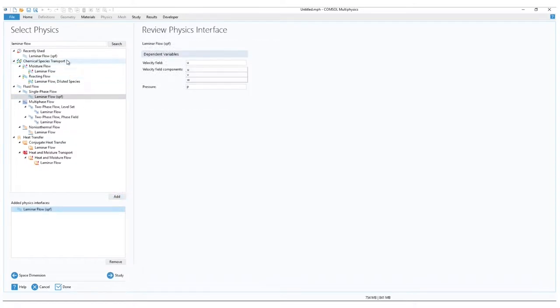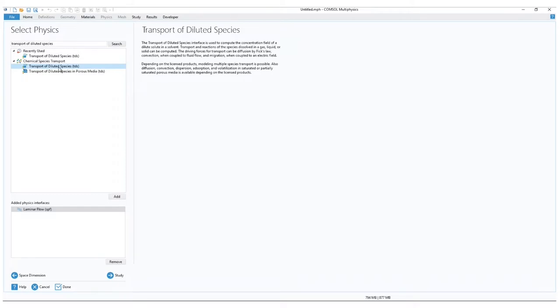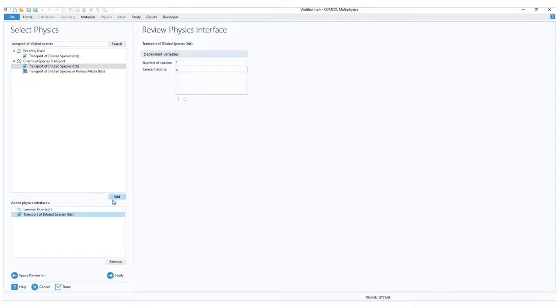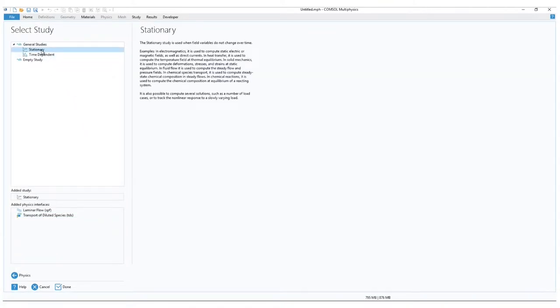We will also add a second physics. Using the transport of diluted species enables us to simulate different chemical concentrations. And continue over to study. For our exercise, let's choose stationary. And done.